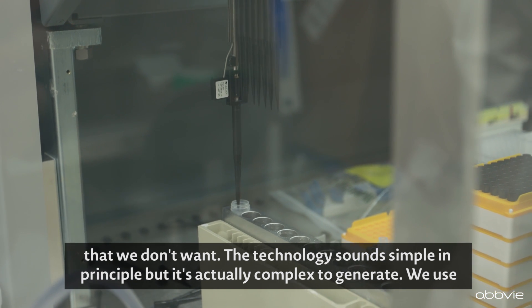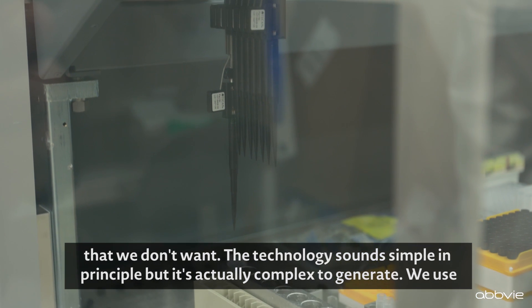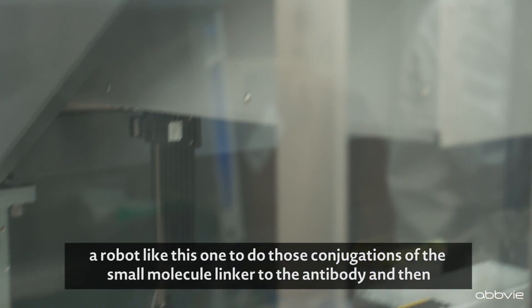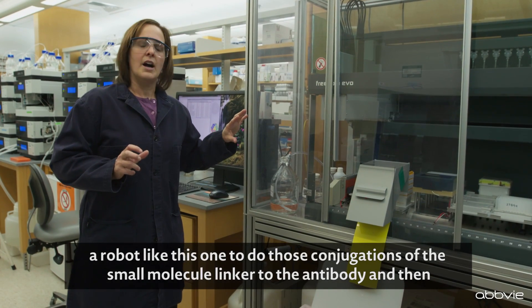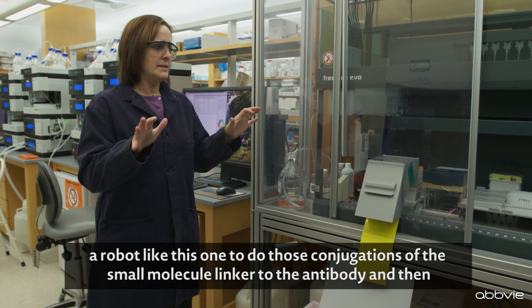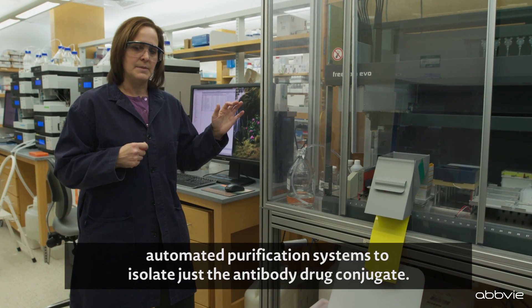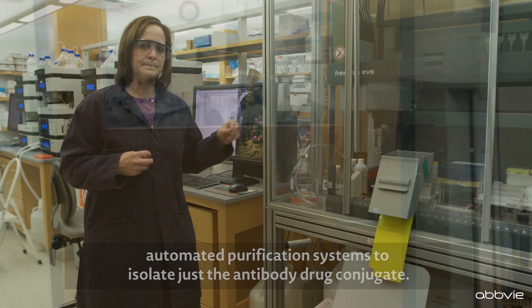The technology sounds simple in principle, but it's actually complex to generate. We use a robot like this one to do those conjugations of the small molecule linker to the antibody, and then automated purification systems to isolate just the antibody drug conjugate.